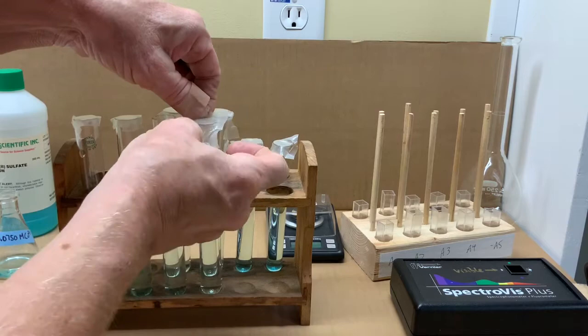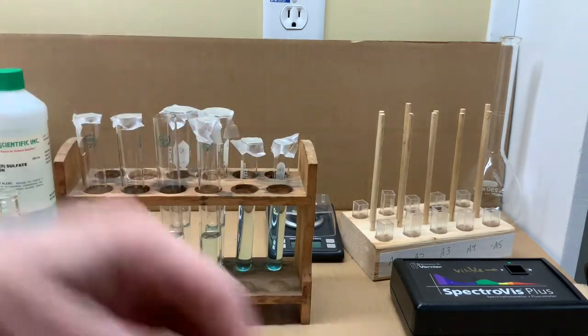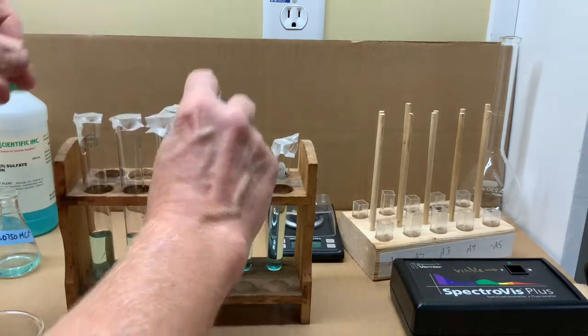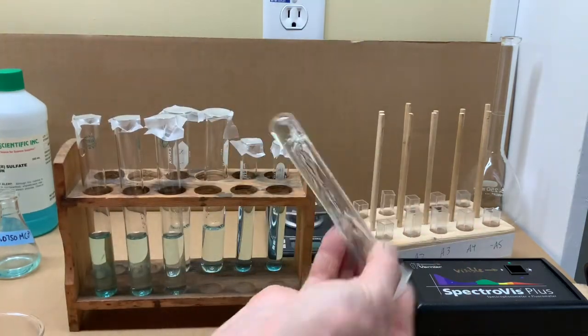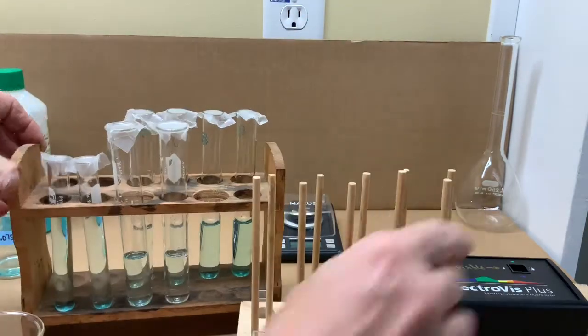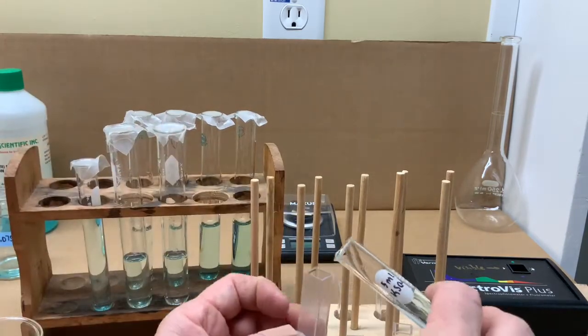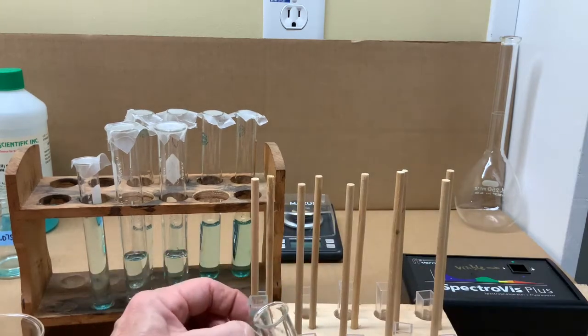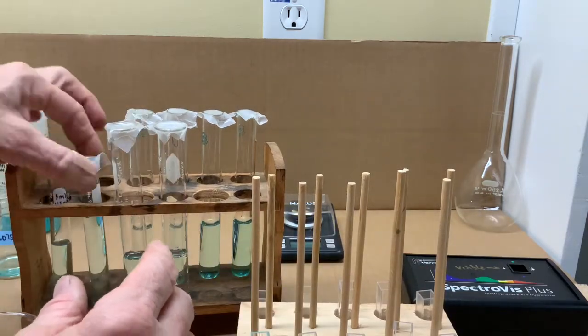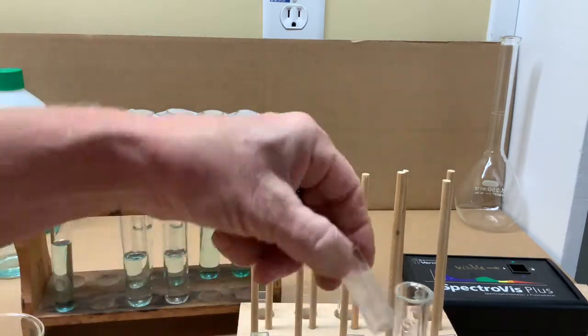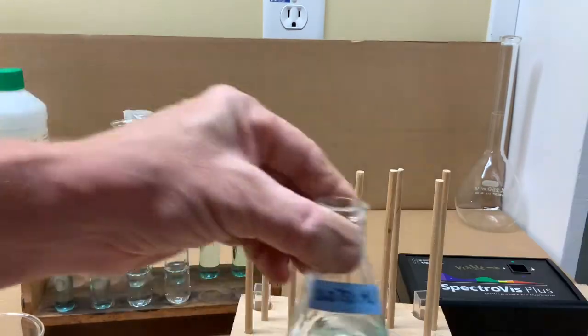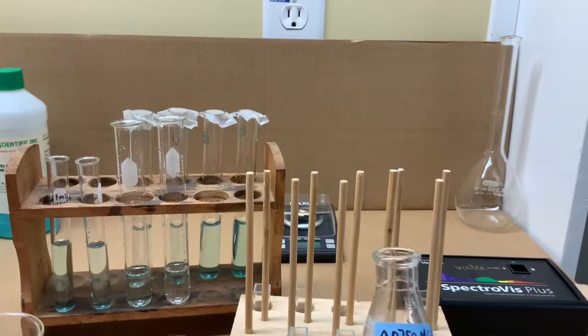Covers will be added so that the solutions can be properly mixed, inverting each one of the solutions so that they will be effectively mixed. And then each solution will be poured into the cuvette so that we'll end up with a complete set of 8 dilutions and the two stock for a total of 10 solutions.